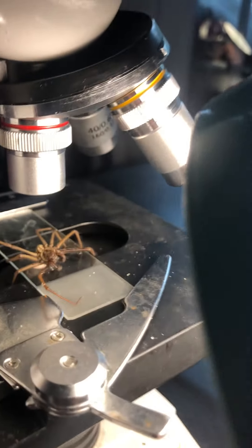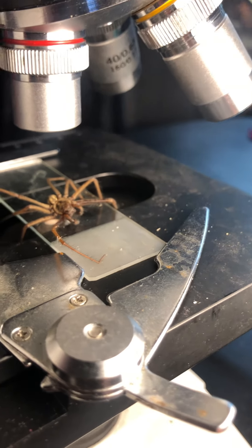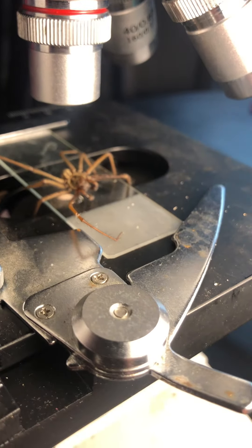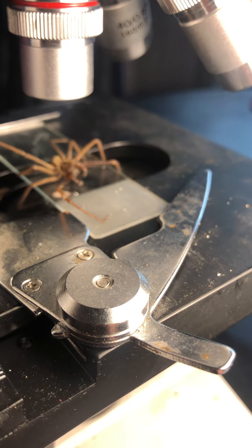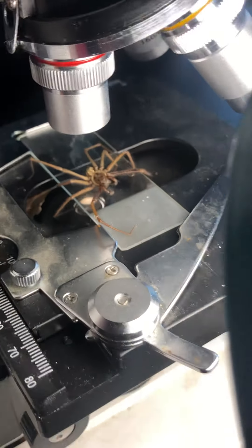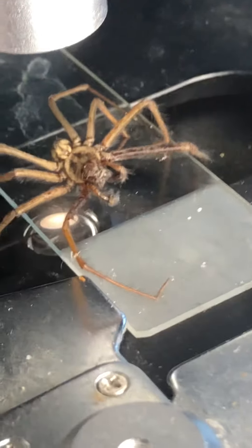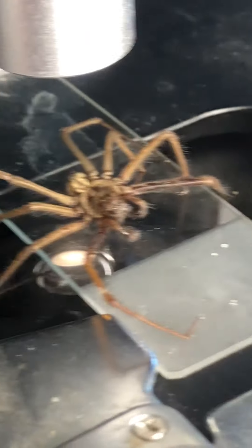Oh, get his eyeballs on. Eyeballs? Oh, that's scary. Honey, can you just do this sense thing? Because I don't know how to do this. I'm only good at this part. Can you just do that part?